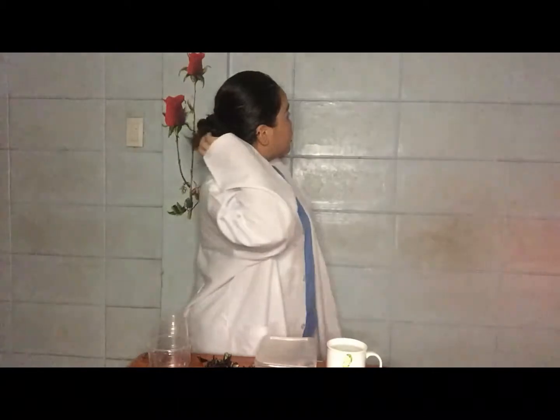First, make sure that your hair is tied to avoid distraction. Second, as you can notice, I am wearing a laboratory gown. This is to protect my skin from unwanted burns. Third, I have here a surgical mask. This is to protect my body, especially my respiratory system, from the smell of those harmful chemicals.